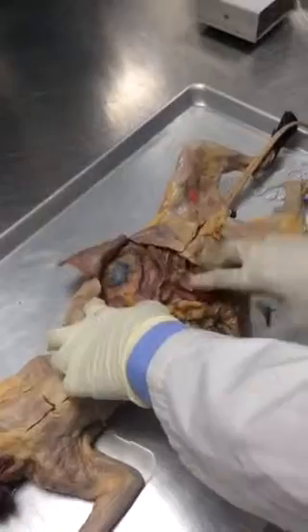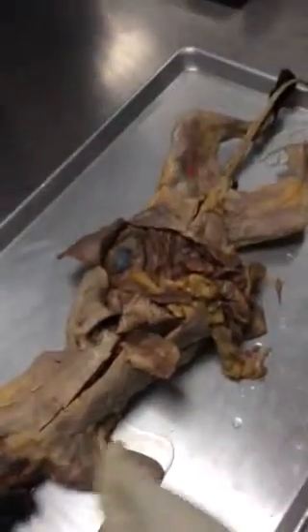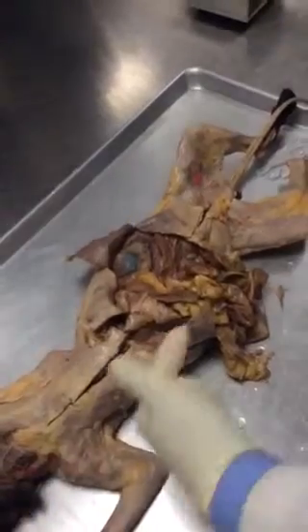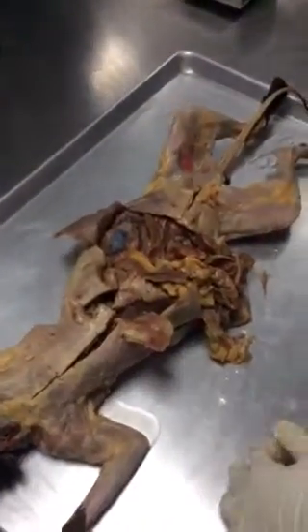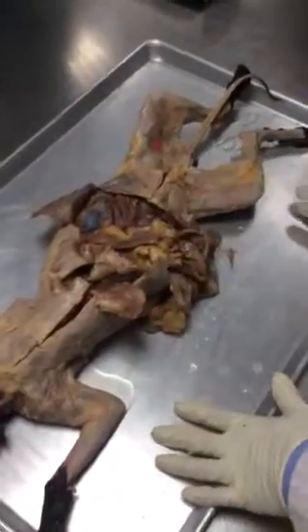She's right, kidneys. How did they mark them blood? After killing the cat, they put some dyes in arteries. They put, no, they're not that cruel. They kill the thing, but not cruelly. They actually euthanize the cat.